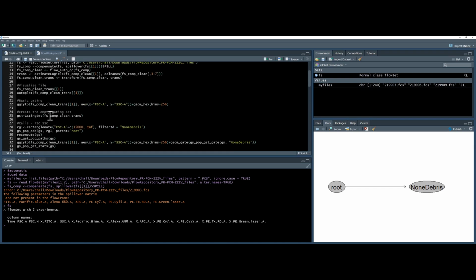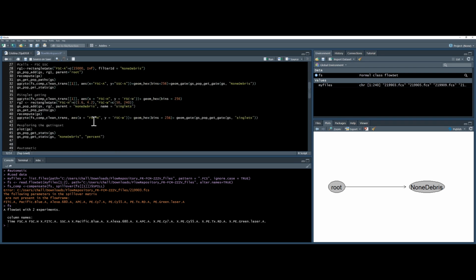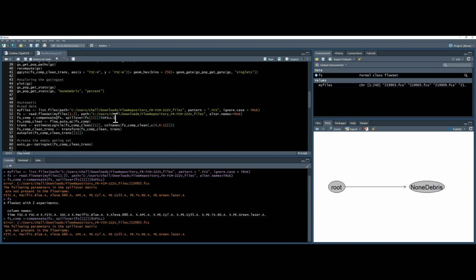So let's have a look at the matrix. I'm just going to copy this command from earlier and bring it down to the bottom because it's in the wrong place. So I know that's not going to work. What I need to do is produce an empty matrix. I can produce a matrix using this spillover fs spill command.